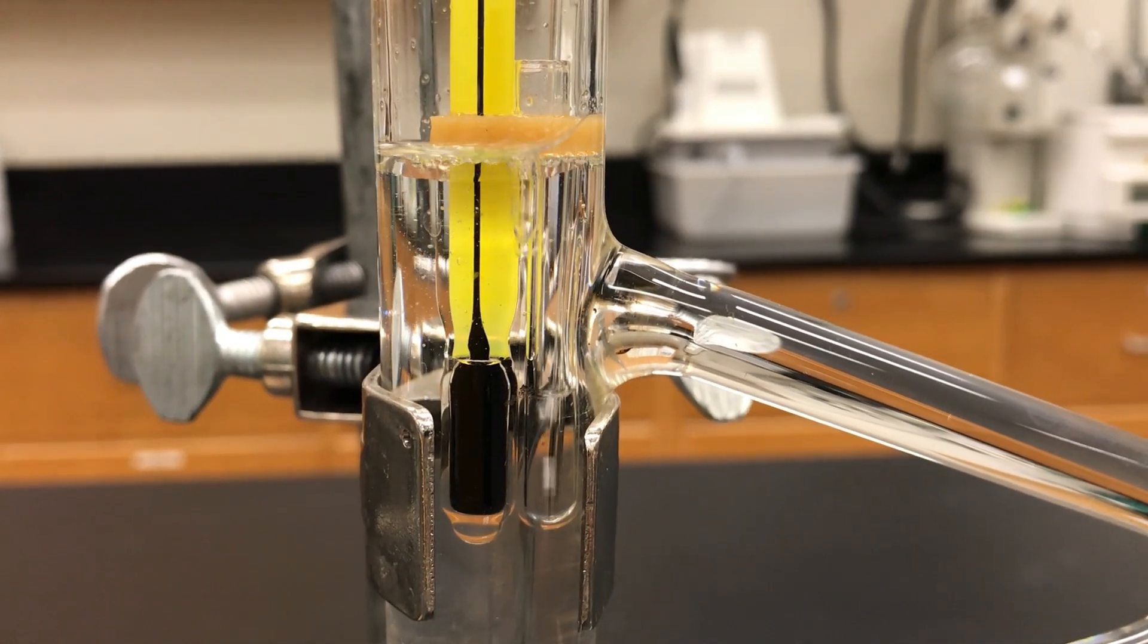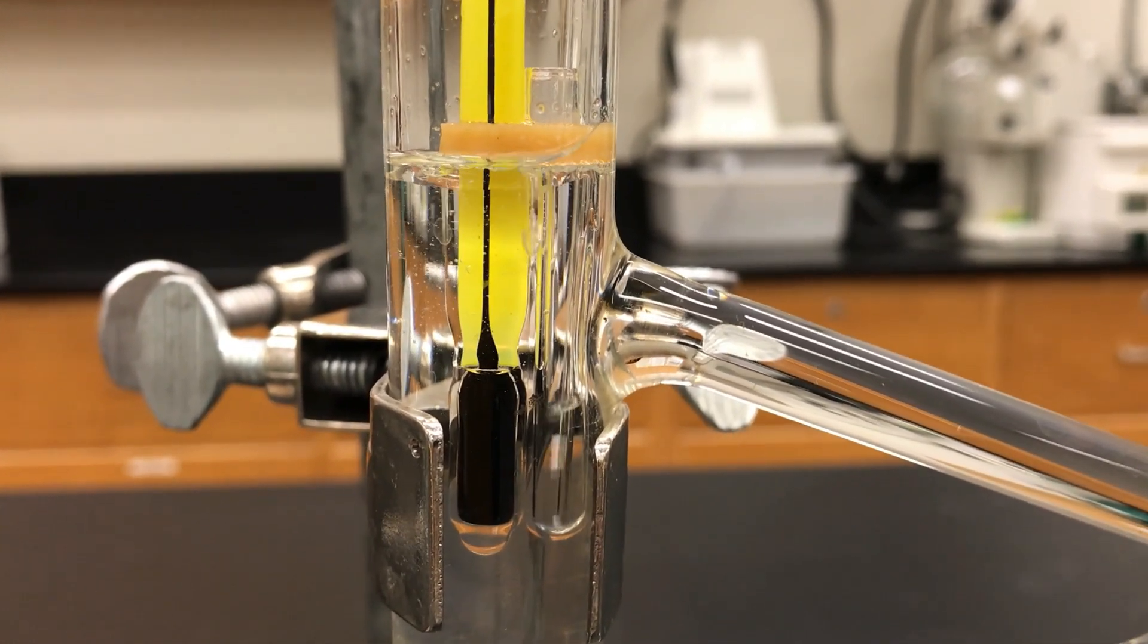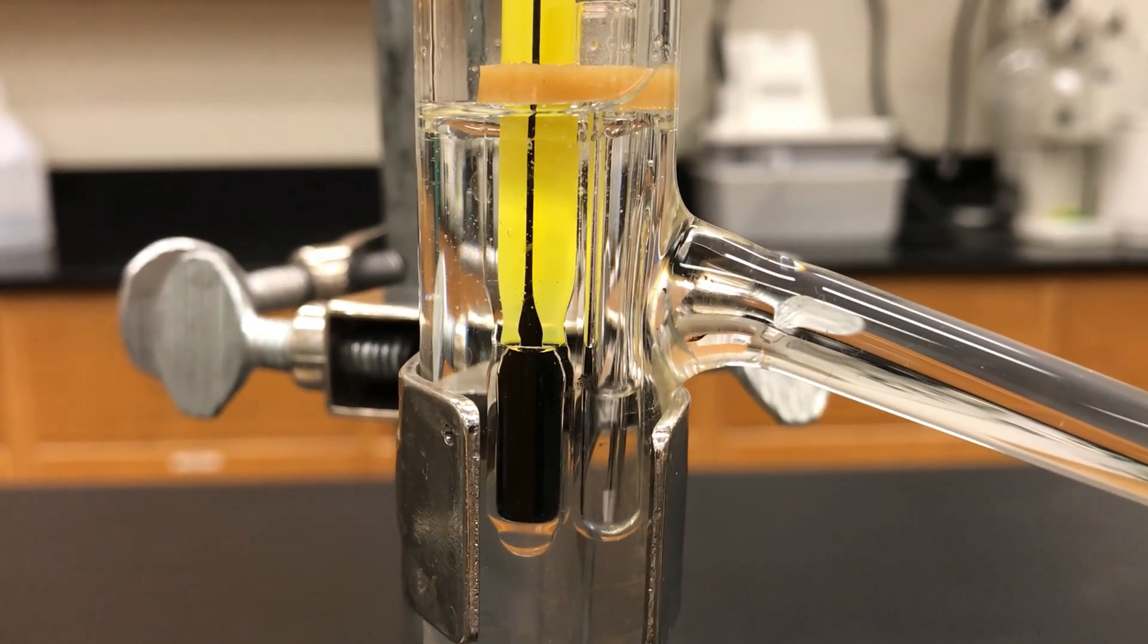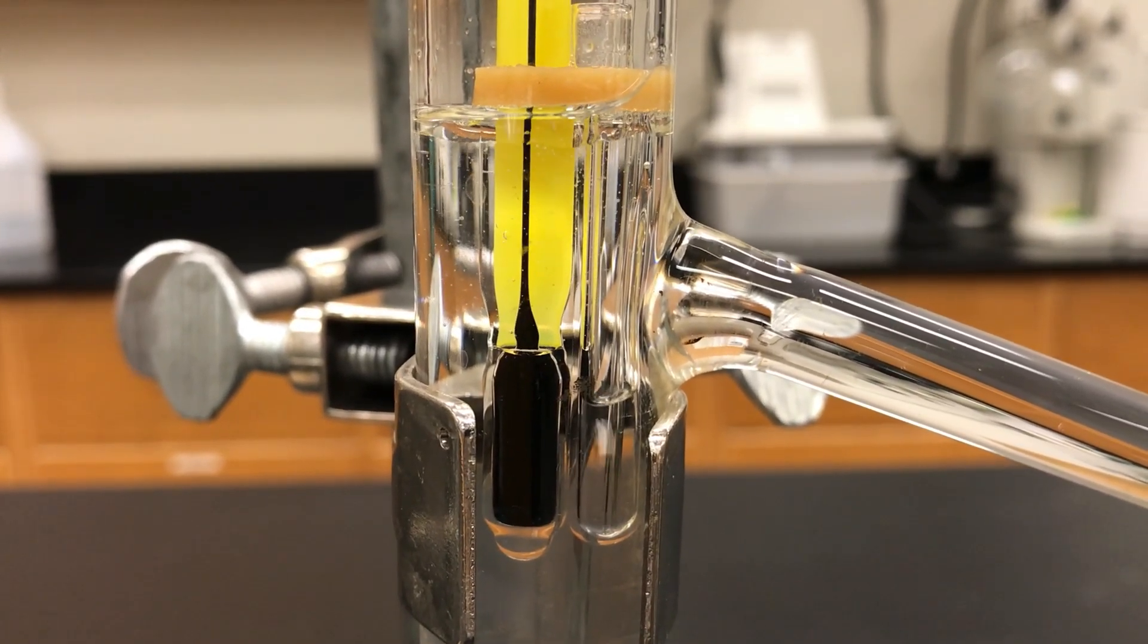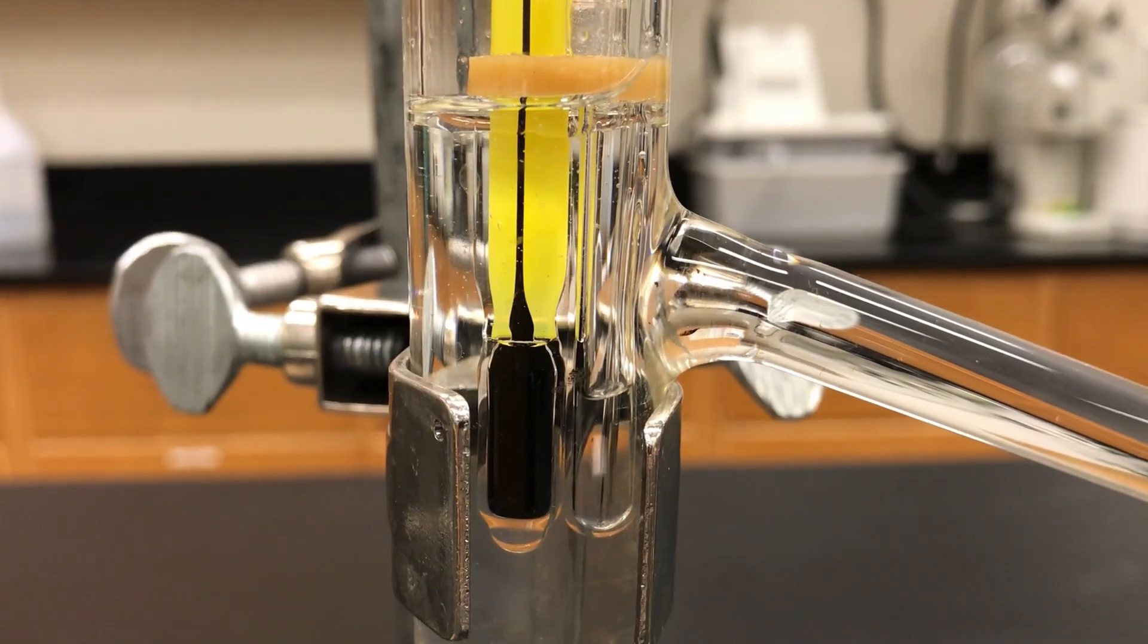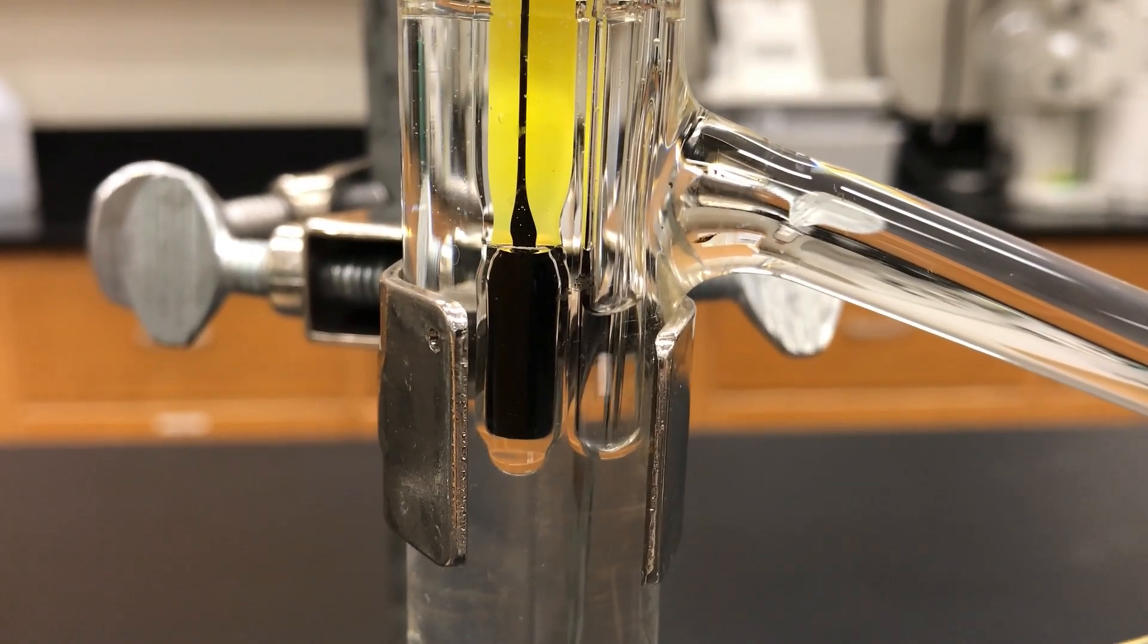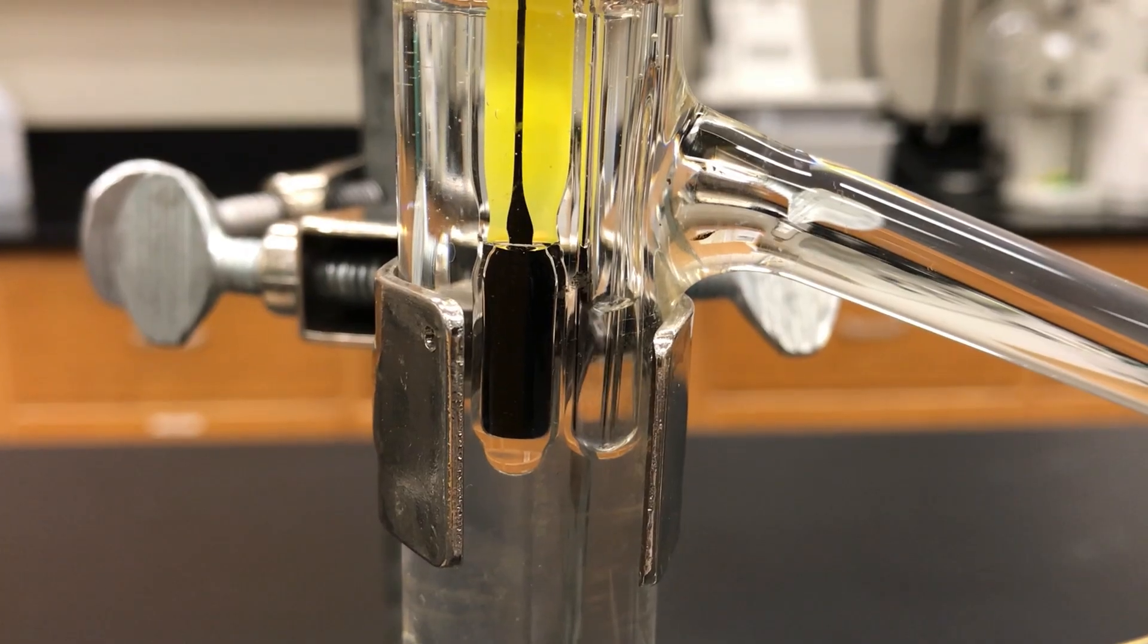So this is actually a sped up video. It's probably about three times the speed. It does take quite a while for the bubbles to stop but eventually they will slow and notice also our liquid level has been reduced as well because a lot has evaporated away or boiled away.